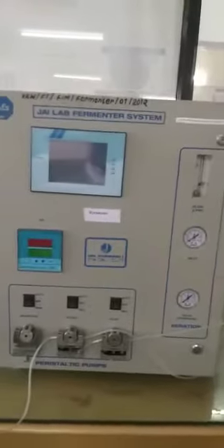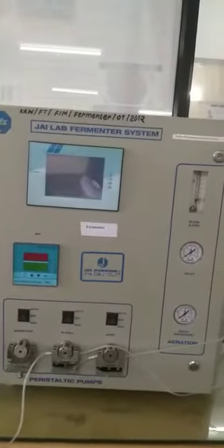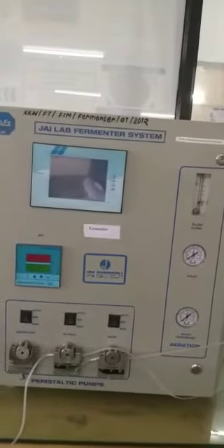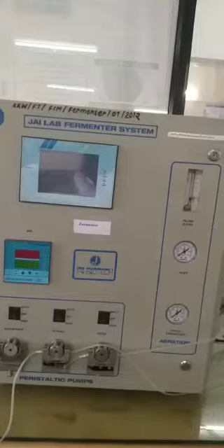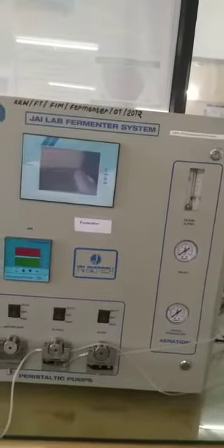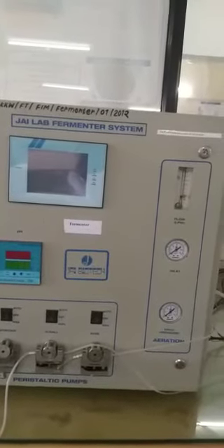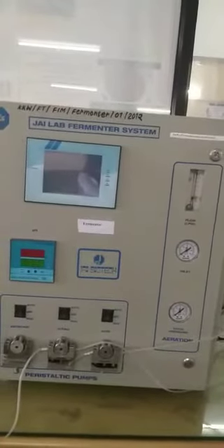This is all about how to work with a lab fermenter. Thank you for listening.